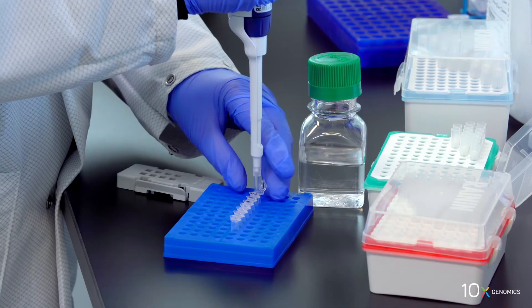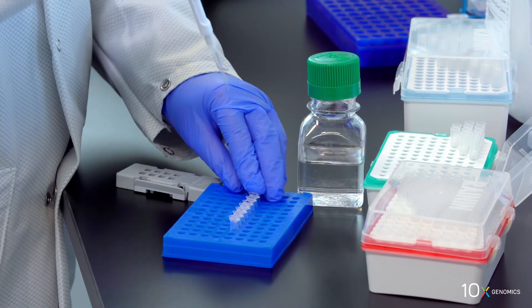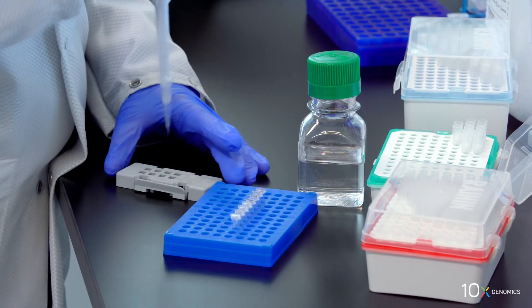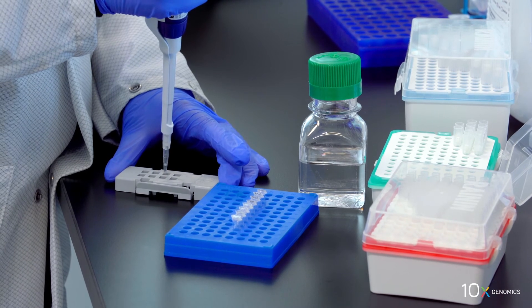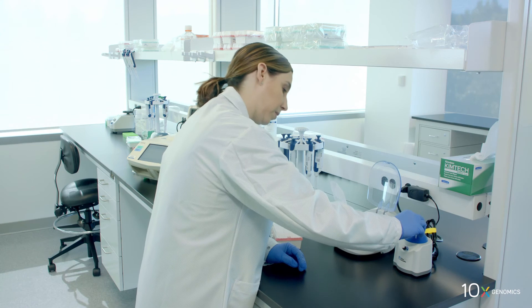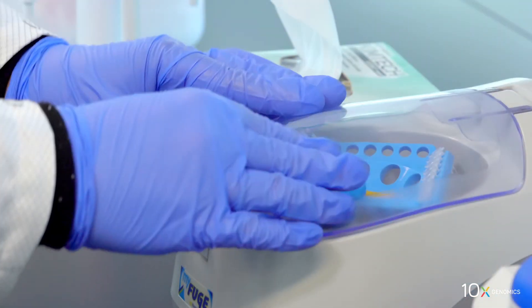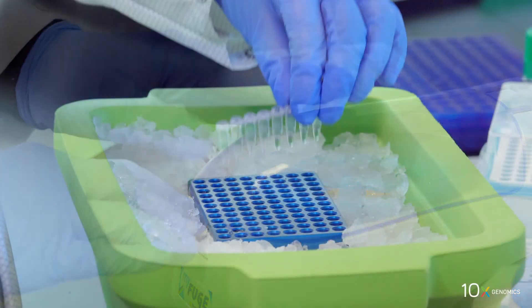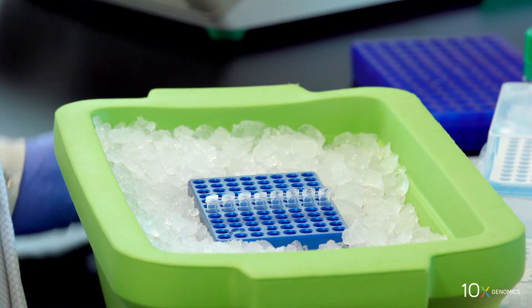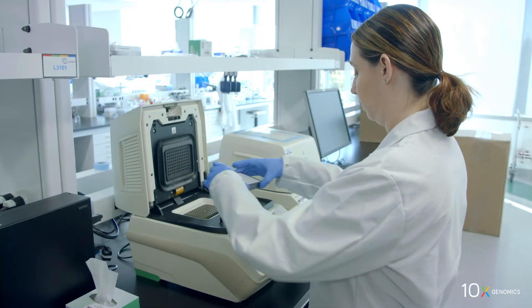Transfer sample from each well to a corresponding tube in the 8-tube strip. Do not discard sample — approximately 1 to 2 microliter volume variation is expected. Vortex, centrifuge briefly, and place on ice. We have completed second strand synthesis and denaturation. Next, we will perform qPCR.